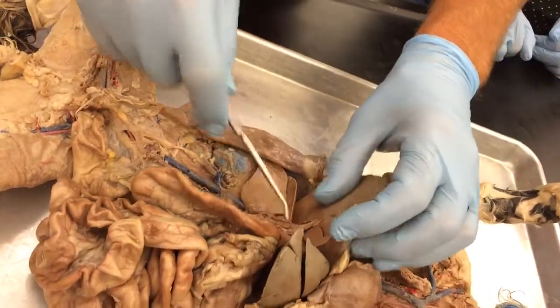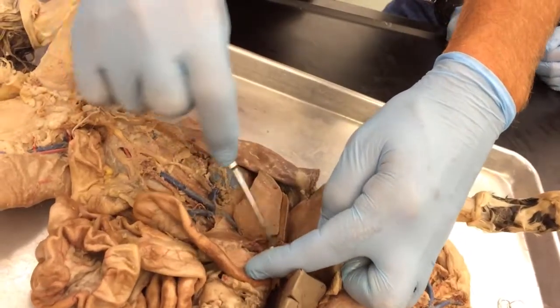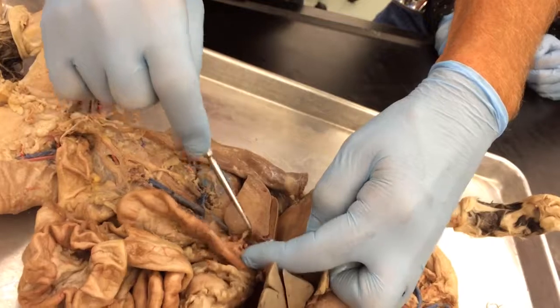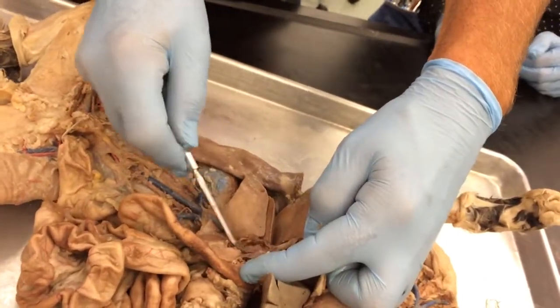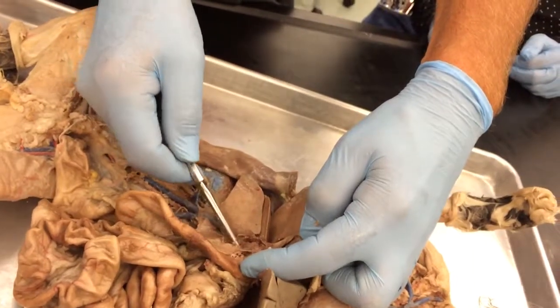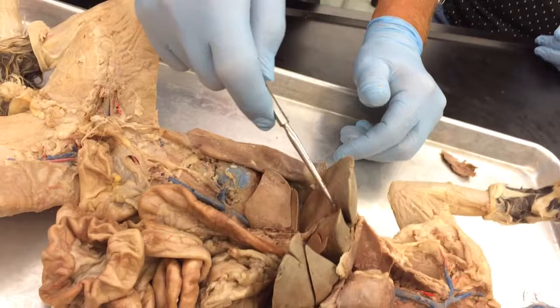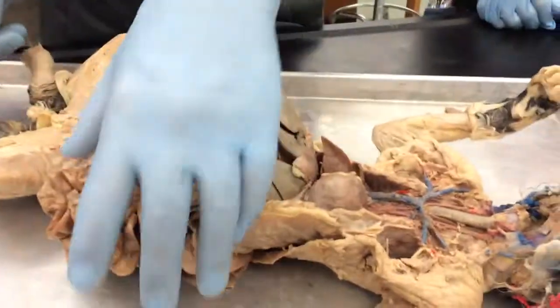You're just going to have to find a kit that has it. I'll find one that shows up good because it's not really injected. It makes it difficult to find, but it's in here somewhere. It's the only thing that would be pinned between the duodenum and the liver. And if I don't find a good one, I won't put it on the test.